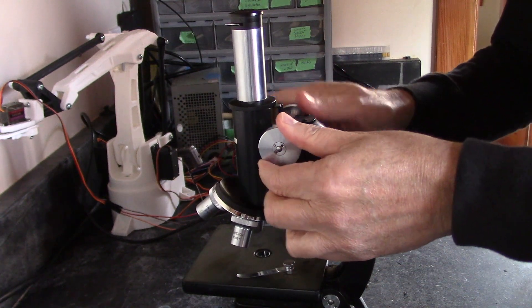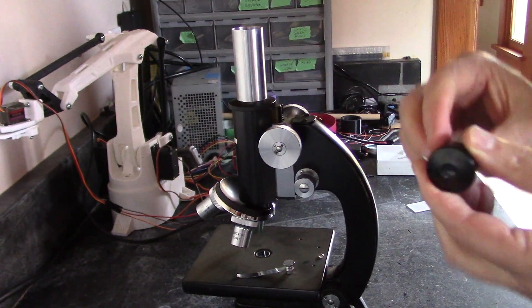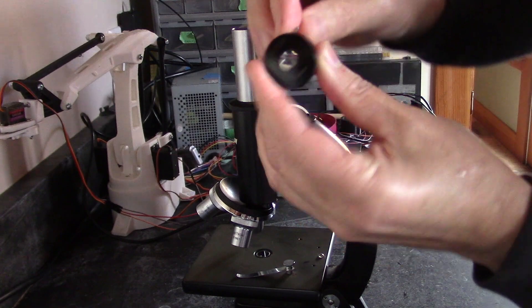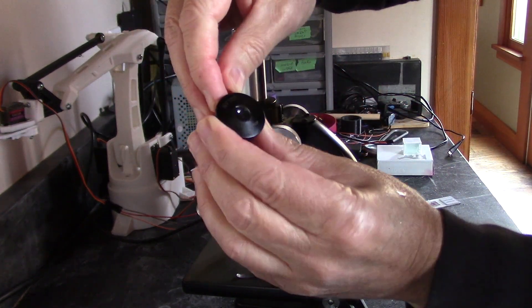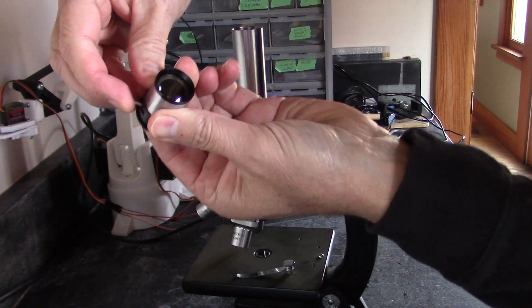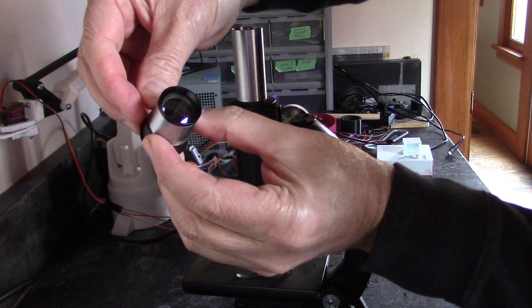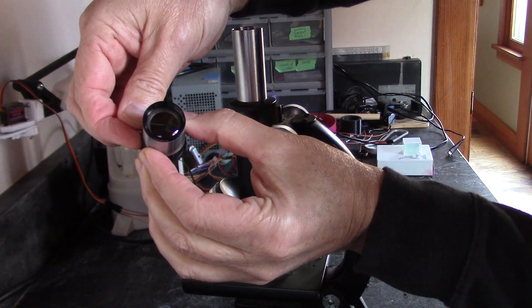And this works so well and it's just built solid as a rock. Just as smooth as can be. And then here on the eyepiece, I've got a little lever right here. And what this does, let's see if you can see that, that swings in a little needle.